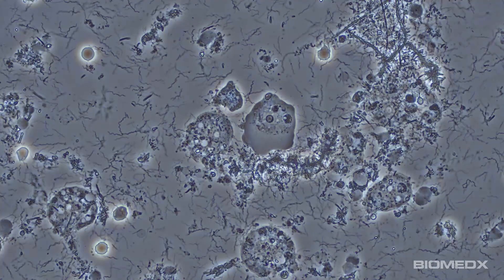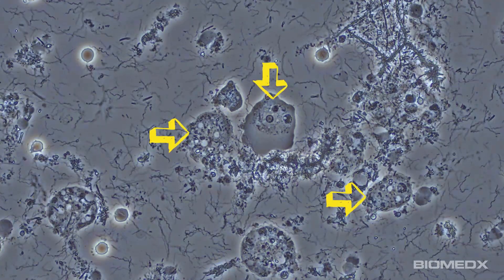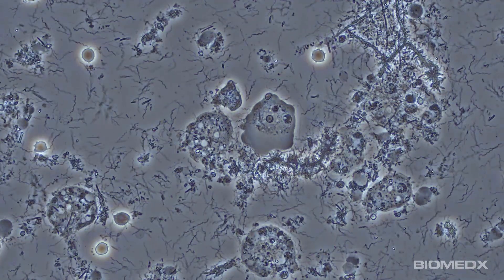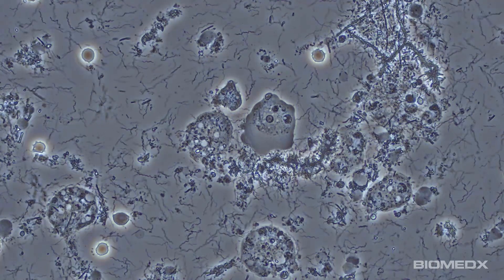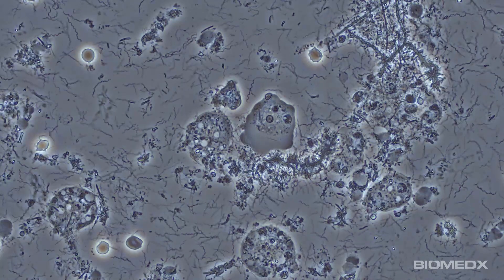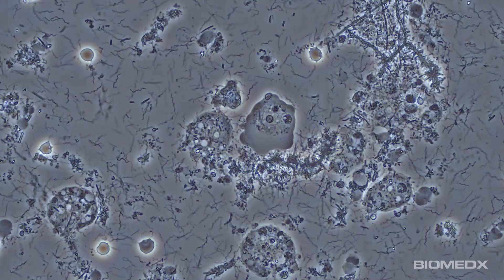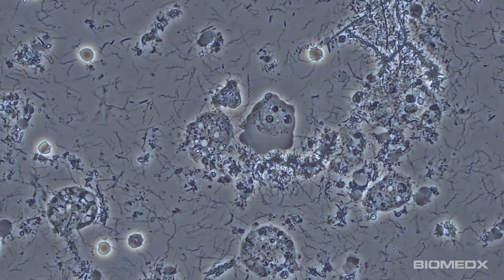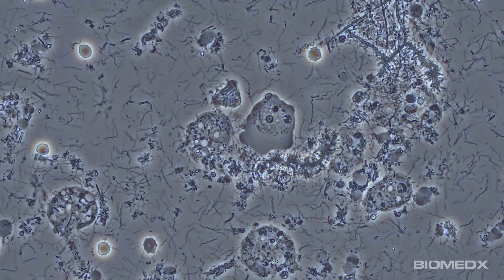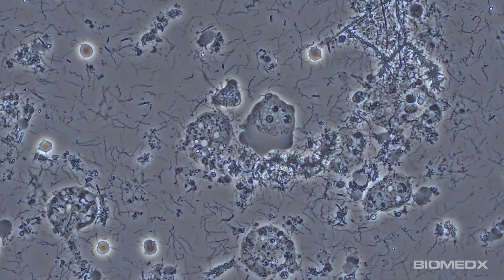The large round globules highlighted here have an appearance inside reminiscent of biofilm and L-form bacteria. The form of microscopy we are using to get this incredible spirochete imaging is phase contrast. We're using a non-oil objective, and to get this level of performance, you really need the superior optics found on our core Olympus systems. Knock-off brands just won't give you this level of clarity. The phase shading variation also tends to be far superior in many respects over old-school dark field microscopy, where the delineation — particularly where biofilms are involved — is never this good.